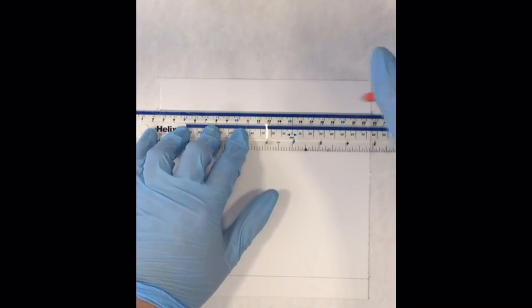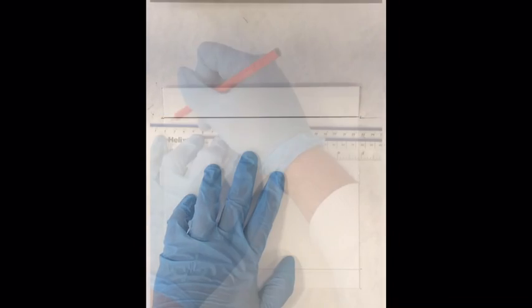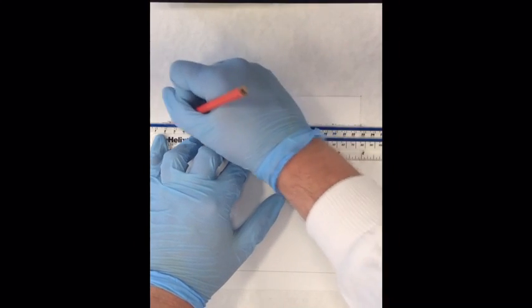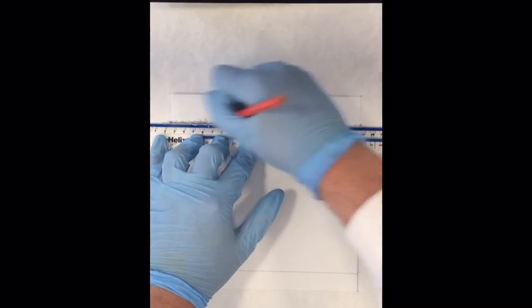Draw a line across the top of the plate. Using a pencil, etch into the silica and remove a small layer of silica across the top of the plate.